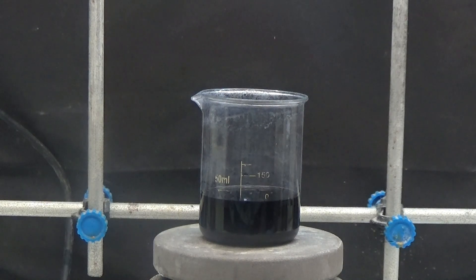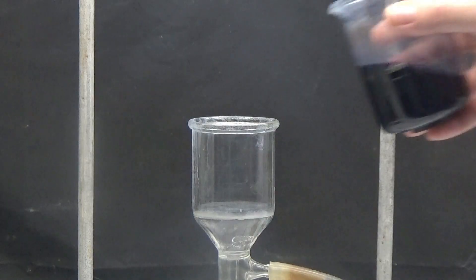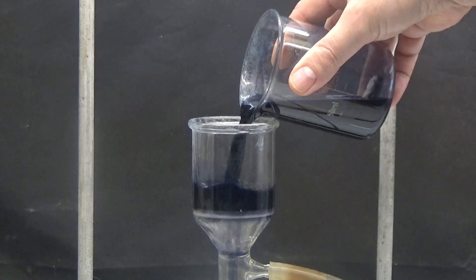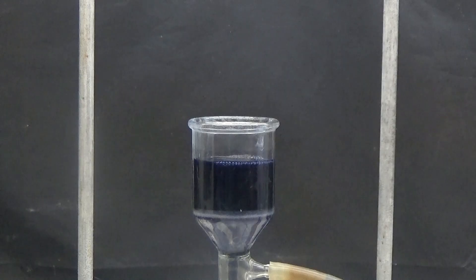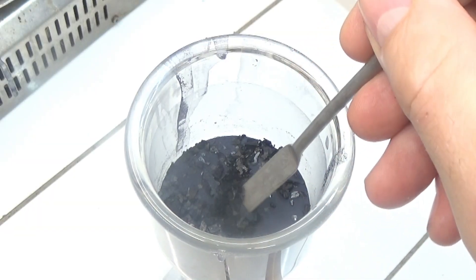Evaporate the alcoholic solution to half its volume. After letting the ethanol solution stand overnight, the crystals are collected by suction. Prism shaped crystals are obtained.